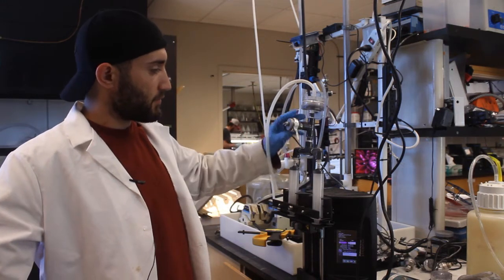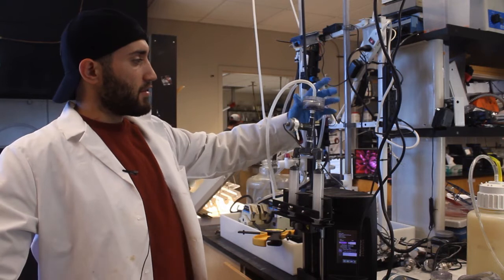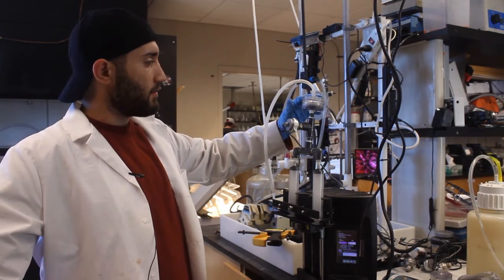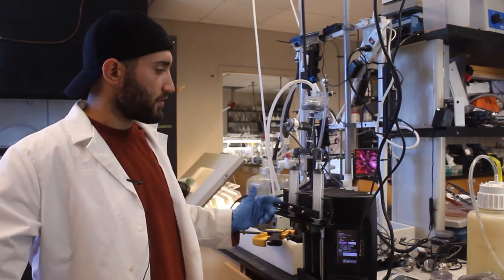So after rinsing we are ready to load the membrane into the system. This is our syringe pump hooked up to a pressure transducer to measure the transmembrane pressure. This is our membrane holder here which is going to house the membrane. And this is our permeate line to collect any permeate samples that we also wish to conduct.